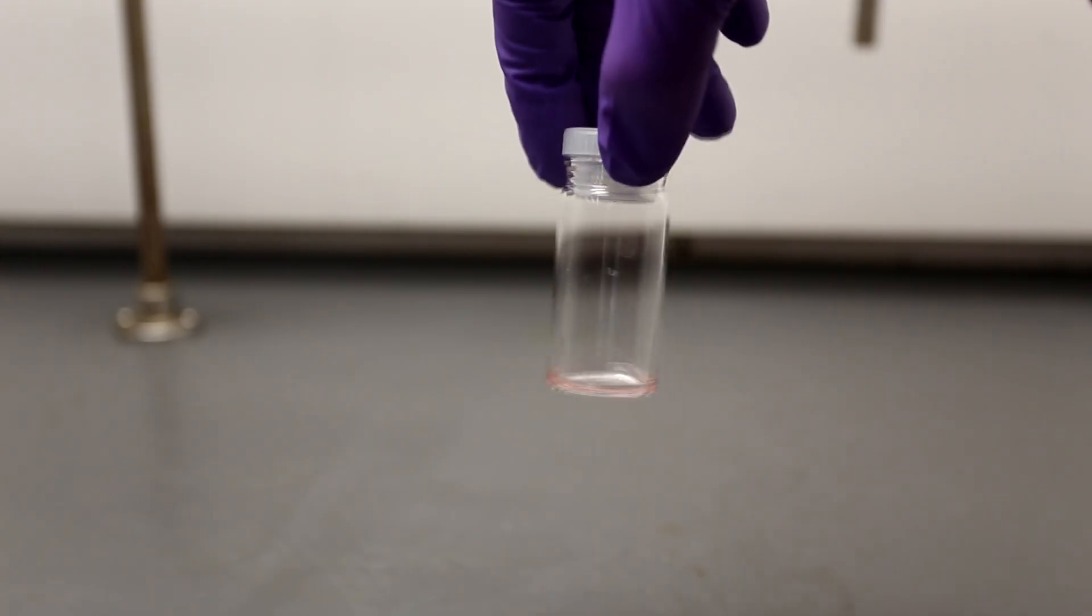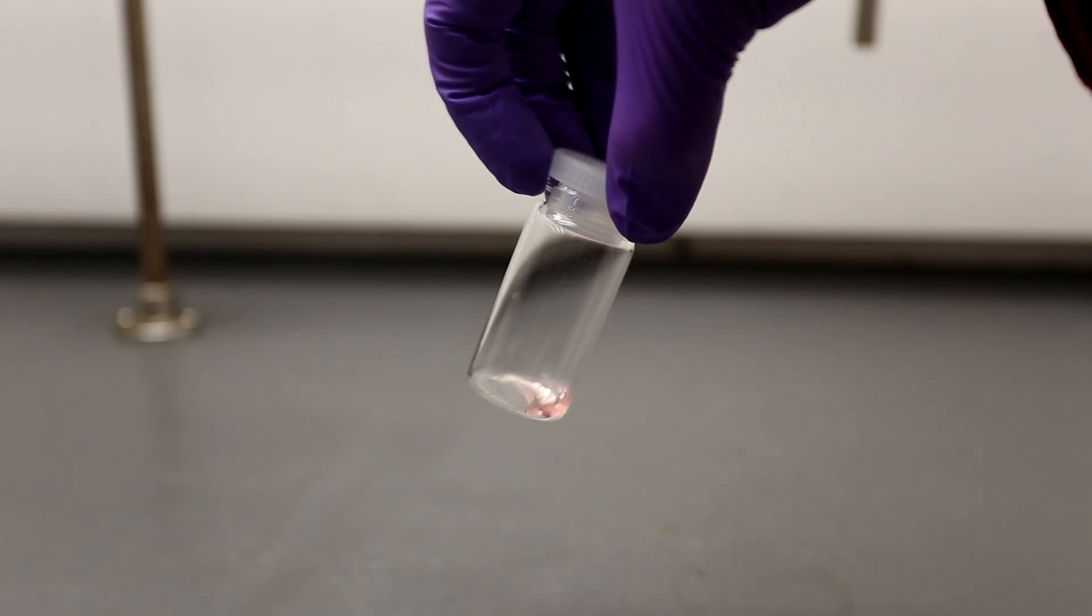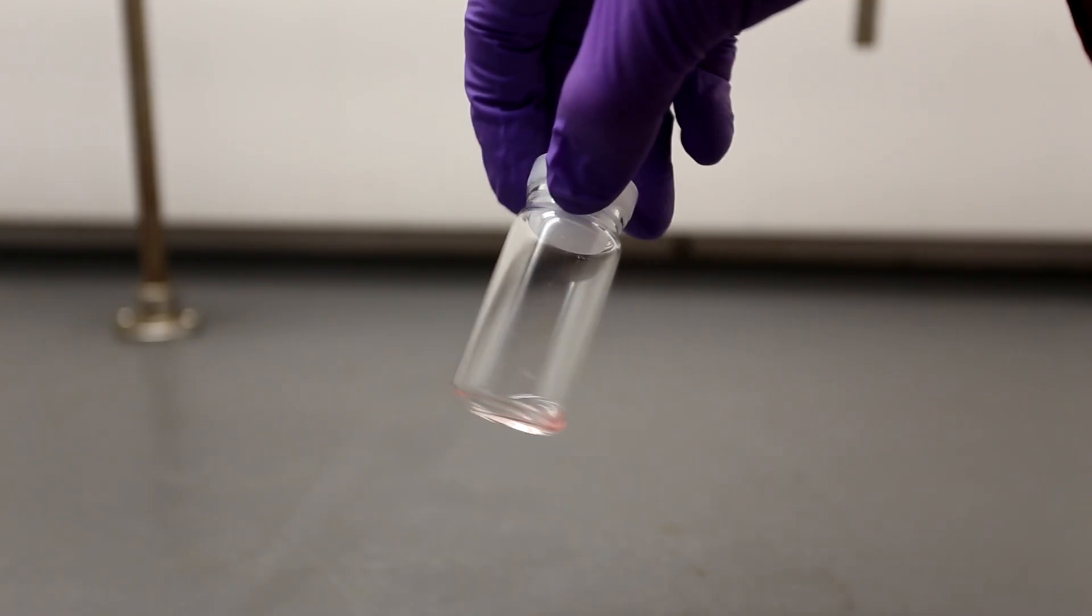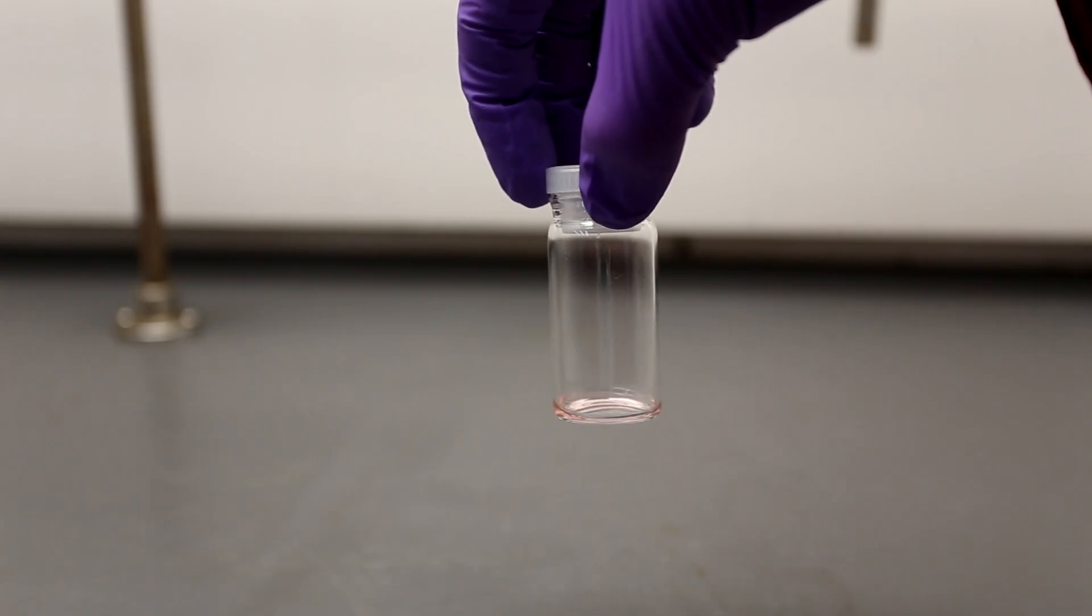Finally I'm left with my final product which is clearly contaminated with something considering the pink color. I'm entirely unsure what the pink color is caused by but I ran an NMR and it came back pretty clean.